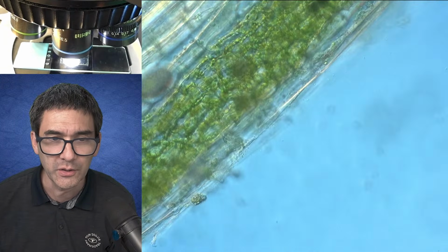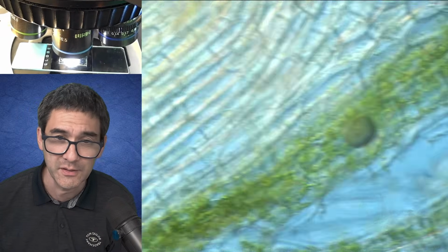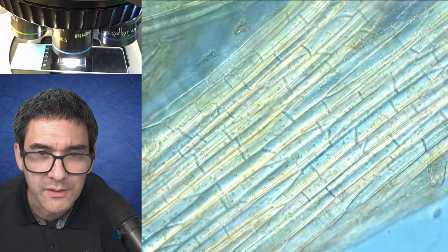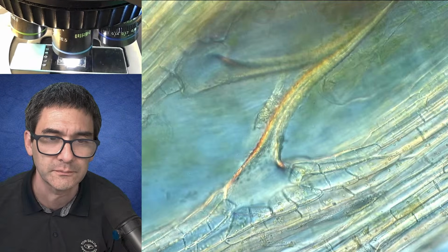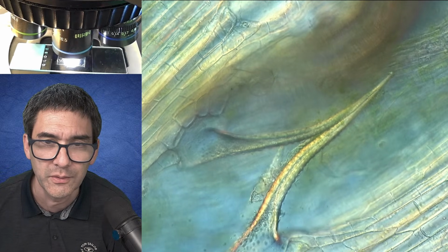There has been a request to make a cross section of the stem. This is going to be a painful experience now for me. Look at this. You can even see the cell organelles here. Ah, that's another one here. Two of them. Look.